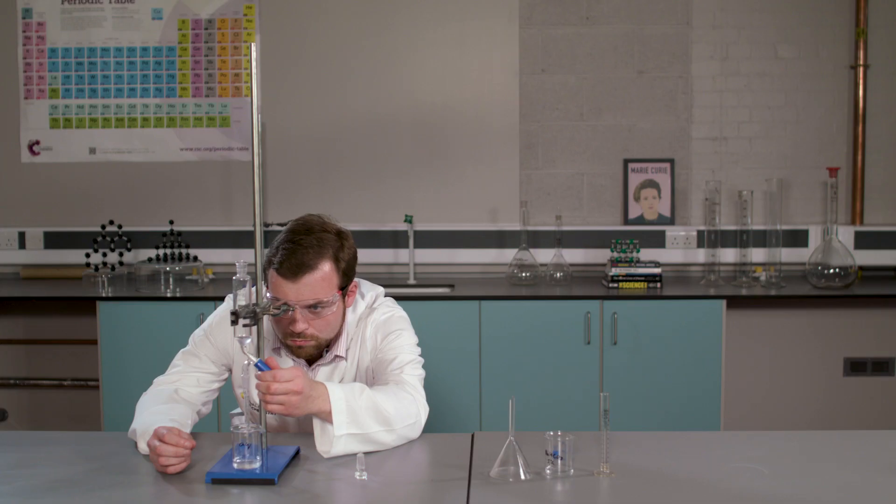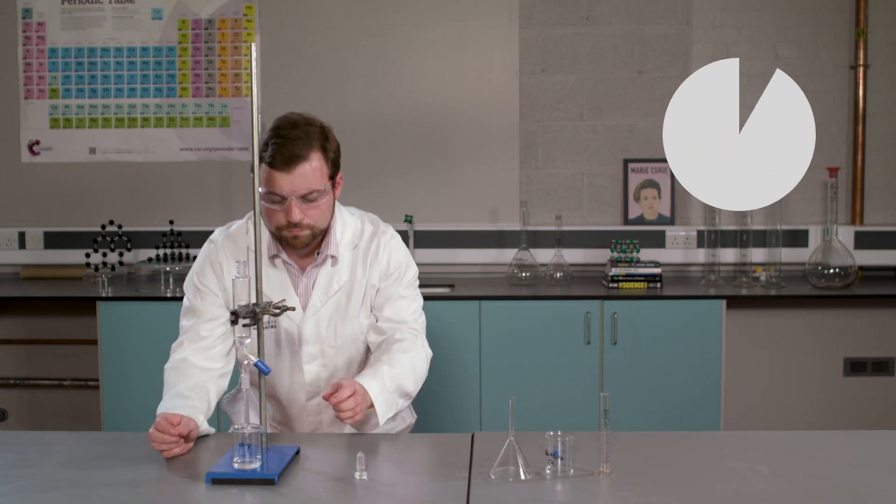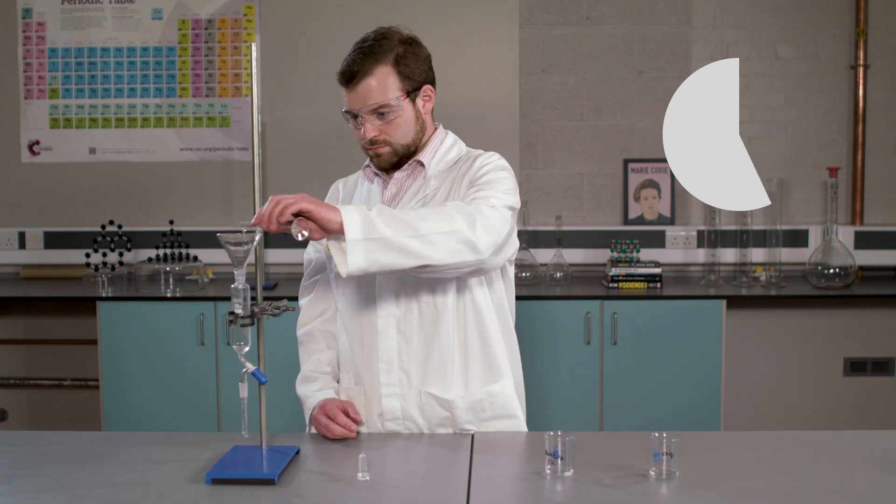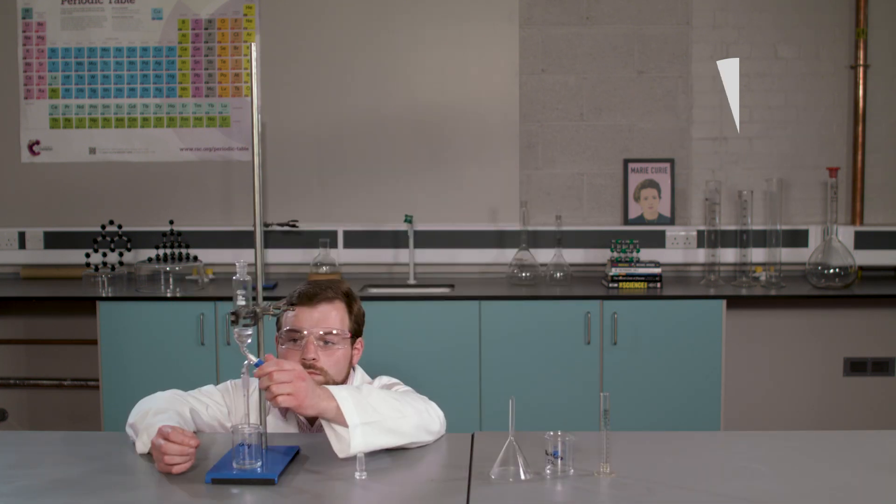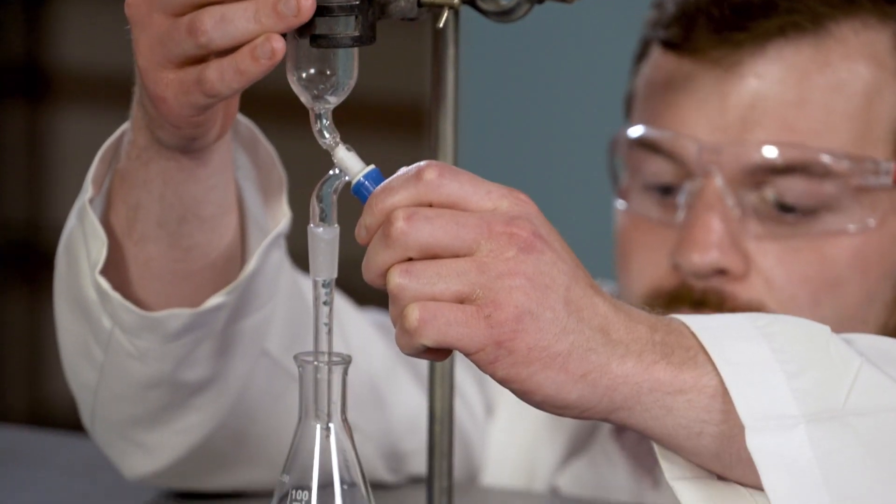I now need to repeat this step once more. I can now collect the organic layer in a clean, dry conical flask.